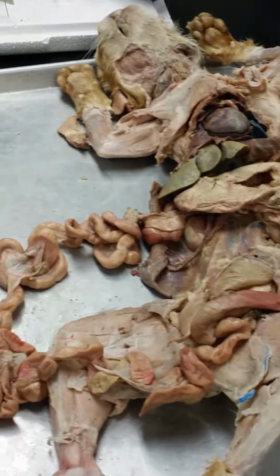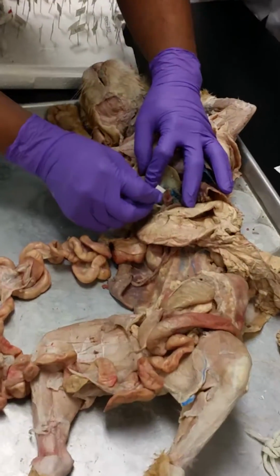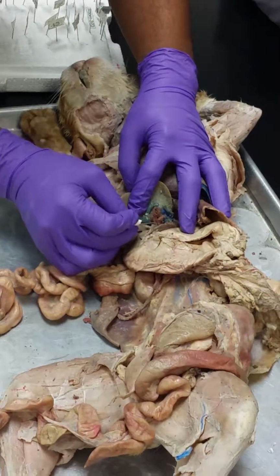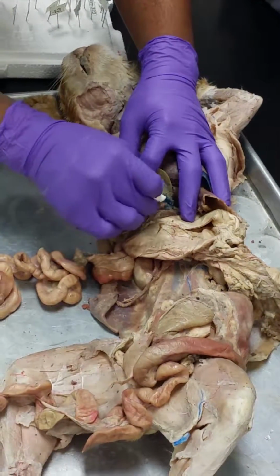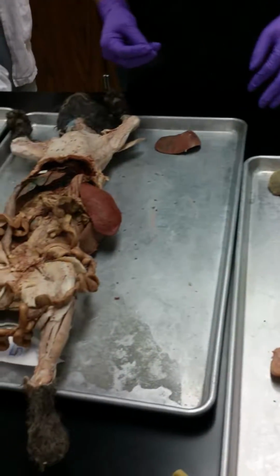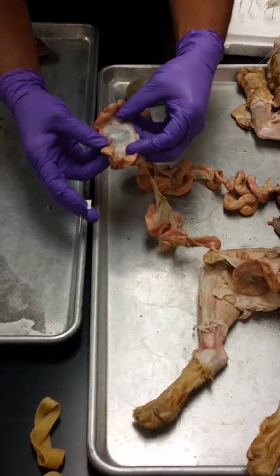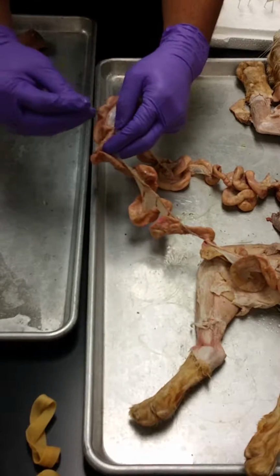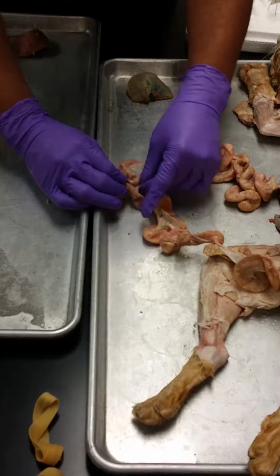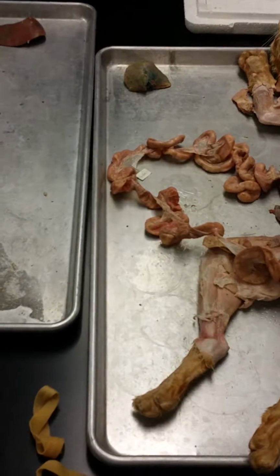Okay, 3. Lesser omentum. On the opposite side, so between the stomach and liver, we're right in here to this membrane. Okay, we're looking at the lesser omentum, just kind of poking at it right there. Okay, 4. Mesentery proper. We have the small intestines, and it's this membrane that now we left a good chunk of connected to the small intestines, is what kept it all raveled up. So mesentery proper, how can I place it so you can still see it? There we go. Mesentery proper.